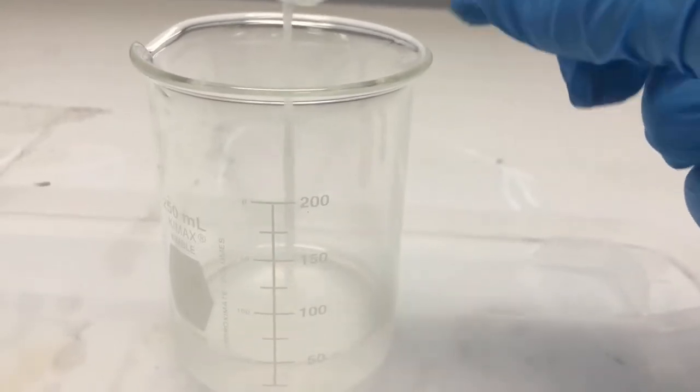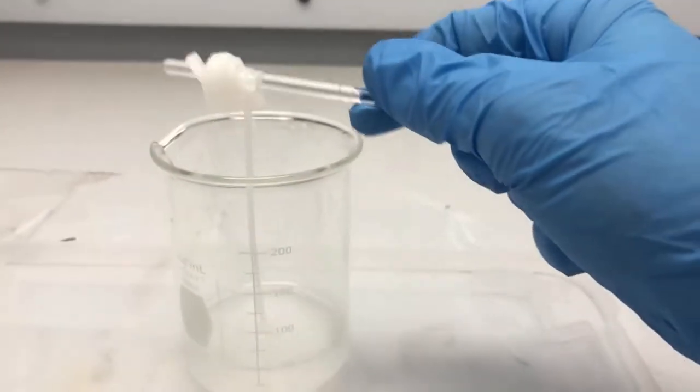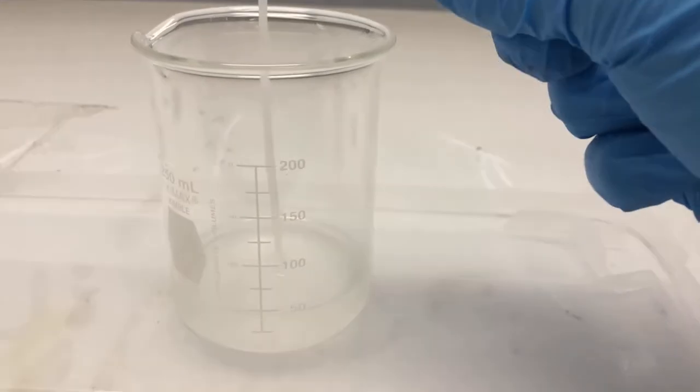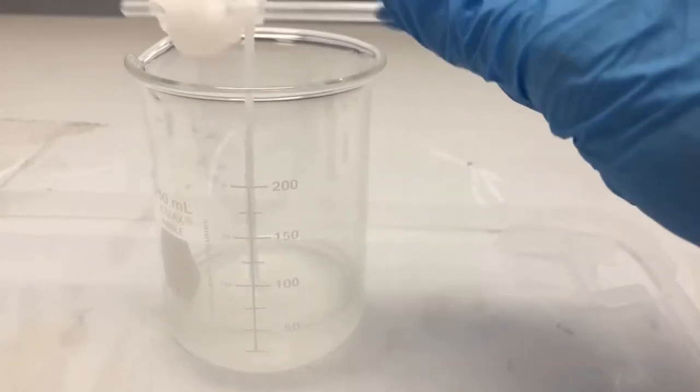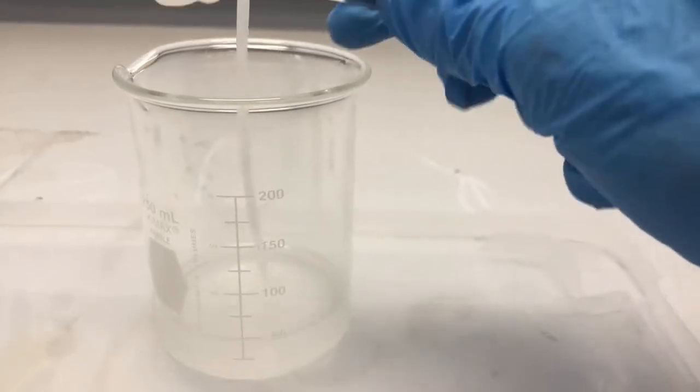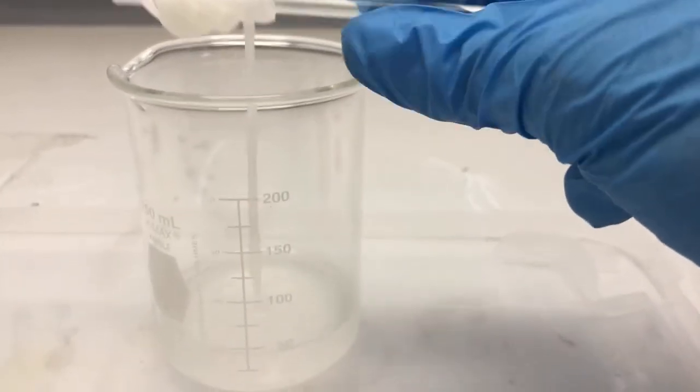Now the key thing is not to touch the side, so I've got it. The only chemistry I know is this nylon polymerization, so I'm an expert in this only. You see it's just coming, and I'm going to pull out the whole solution. So get ready to be bored.